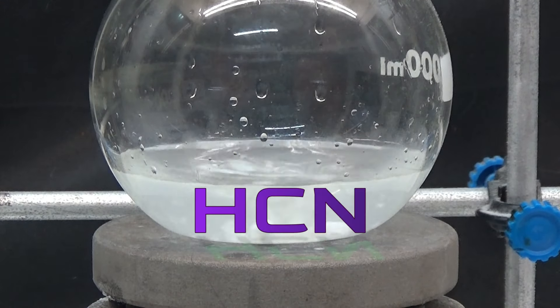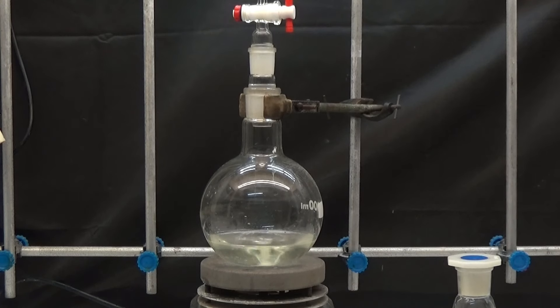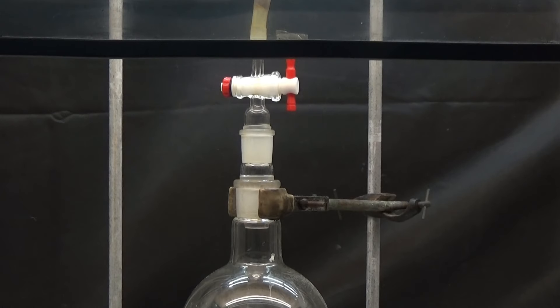In this part, you can already smell the bitter almond scent of hydrogen cyanide. Under no circumstances should you breathe it, and you should work in a fume hood or in open air.